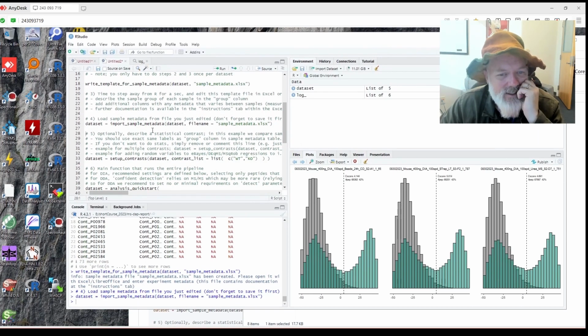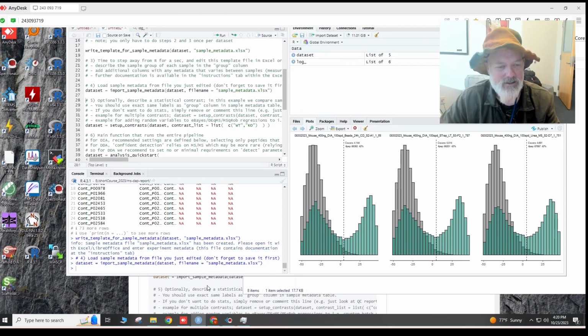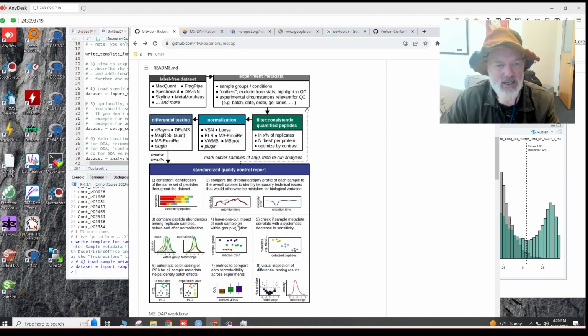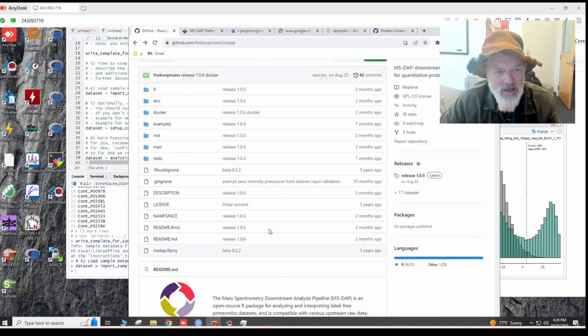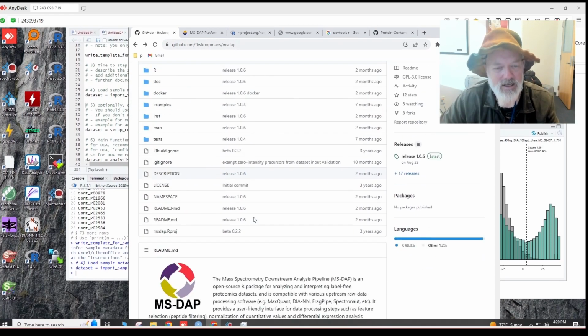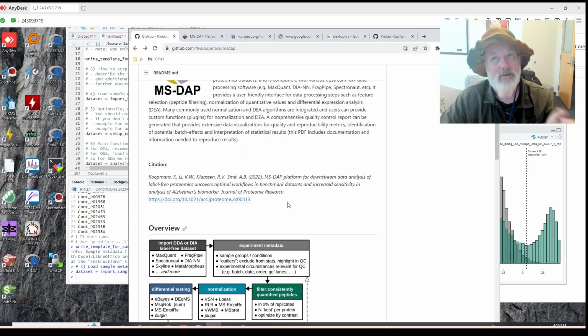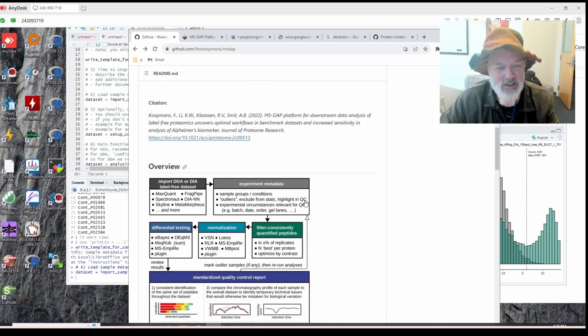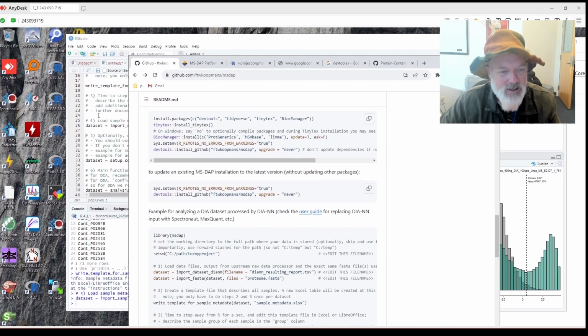All right, so now we set up the contrast. So this is what we're going to compare. In the user's guide this can be quite complex, and I think it's in the manual. You can do multiple contrasts with different conditions and set up one condition versus two, or basically do all conditions, I think. So we're only going to try two for now.